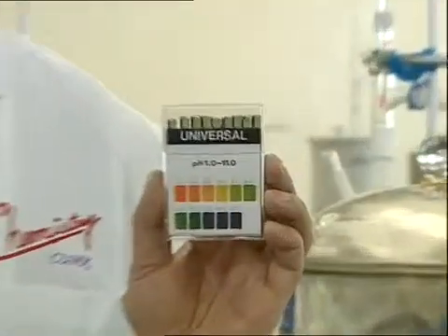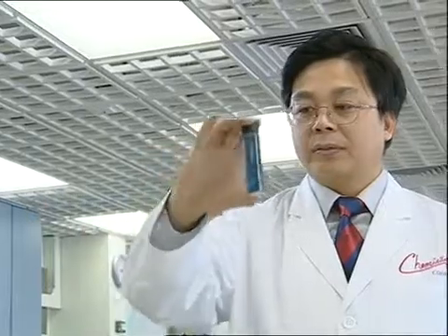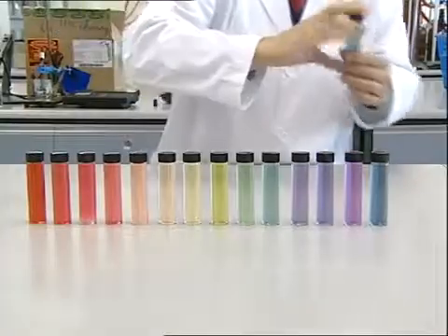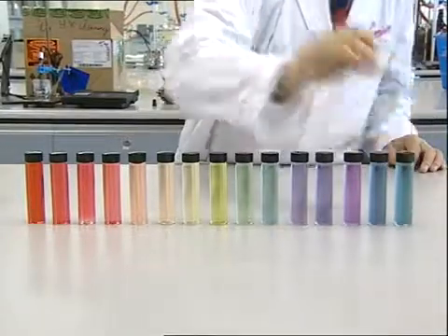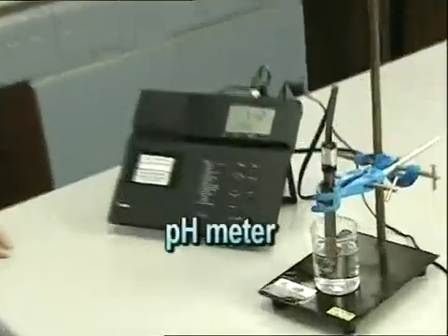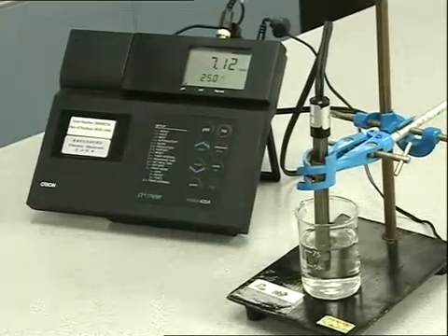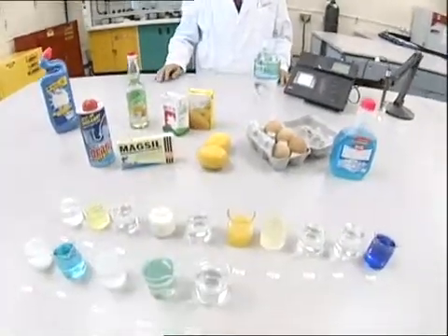So we usually use the color chart to check up to pH 11. Besides, judging the color simply with the naked eye is not very reliable. A pH meter is designed to measure the pH values of substances. This digital pH meter can measure very accurately. Let's take a look at the pH values of the following substances.